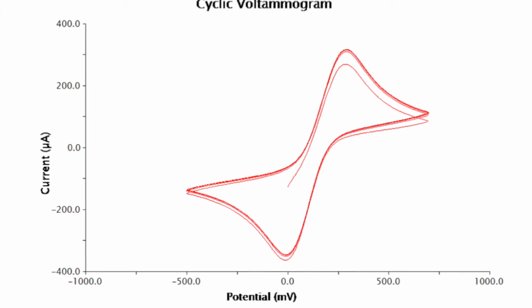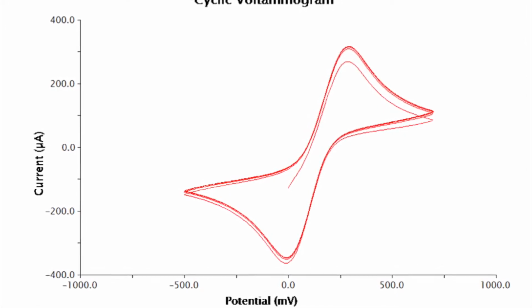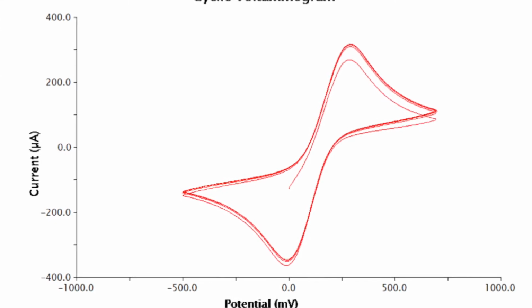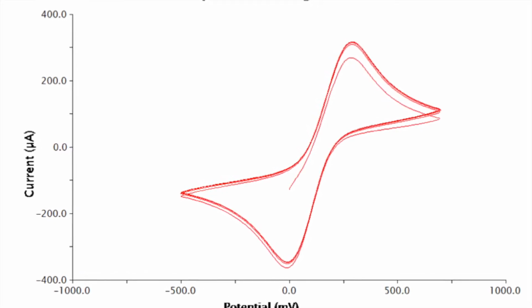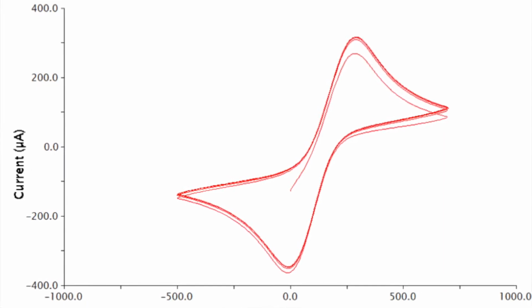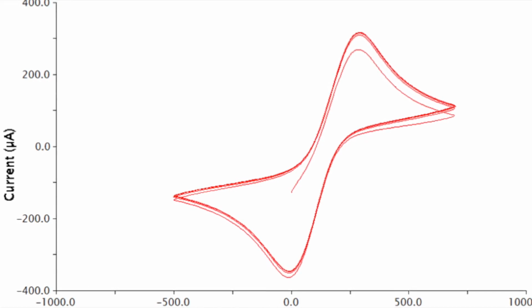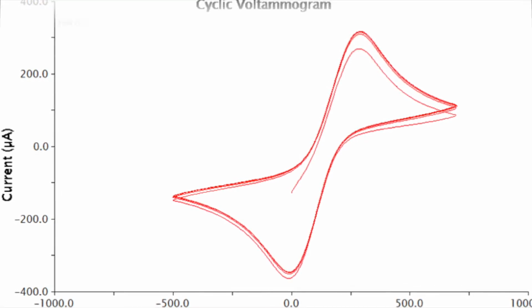This is the final cyclic voltammogram, which looks similar to that of the Heineman-Kissinger experiment. Unlike a linear voltammogram, the cyclic voltammogram has loops, the number of which is dependent on the number of segments entered in the parameters. In our case, we had 10 segments, which equates to 5 full loops, as shown here.